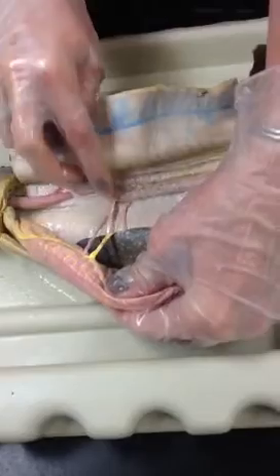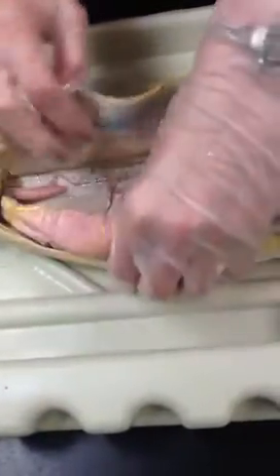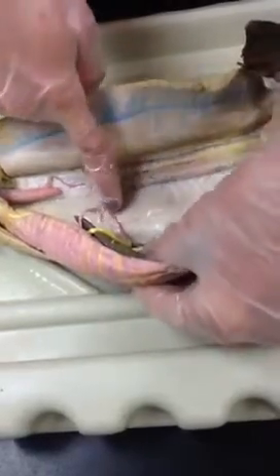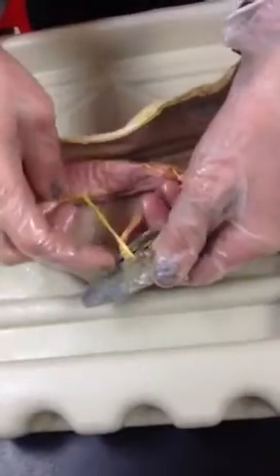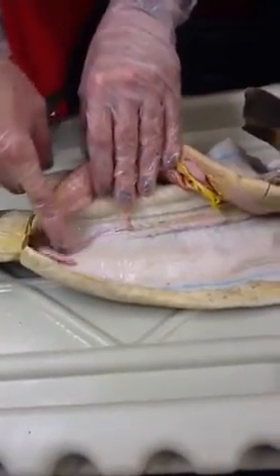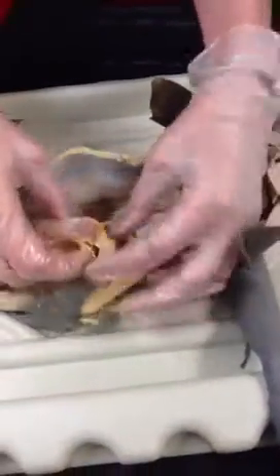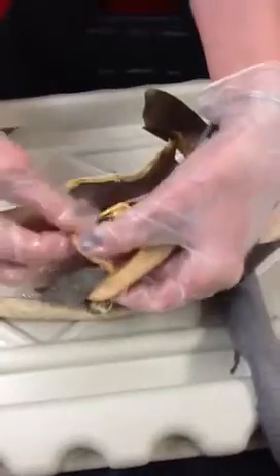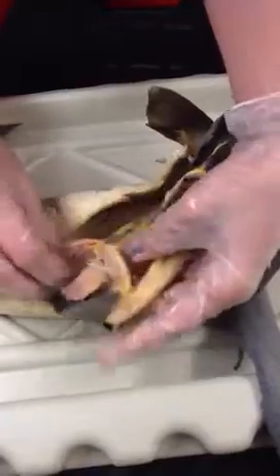The posterior intestinal is going to come from the dorsal aorta, go back up onto the underside of the intestines. And the other one that comes from the dorsal aorta here is going to be your gastrosplenic artery that comes all the way over into the spleen and then up into the stomach. Down here we have our rectal gland. The rectal gland has the posterior mesenteric artery that's going to connect it. We also have our 3 branches, which I'm not too keen on, so I'm going to skip that for right now.